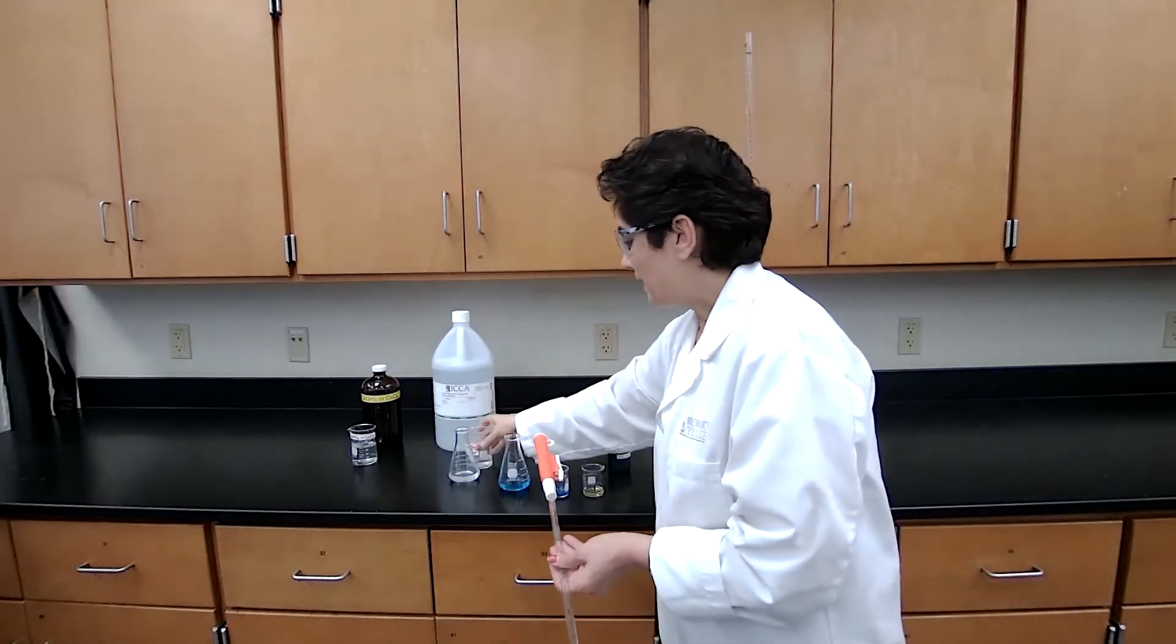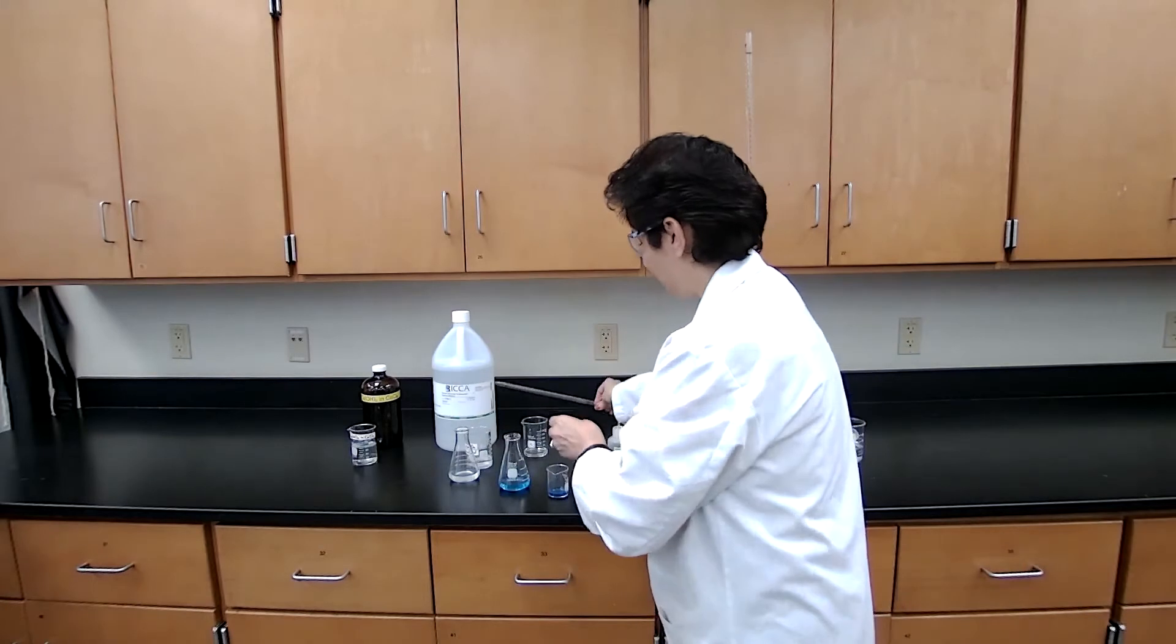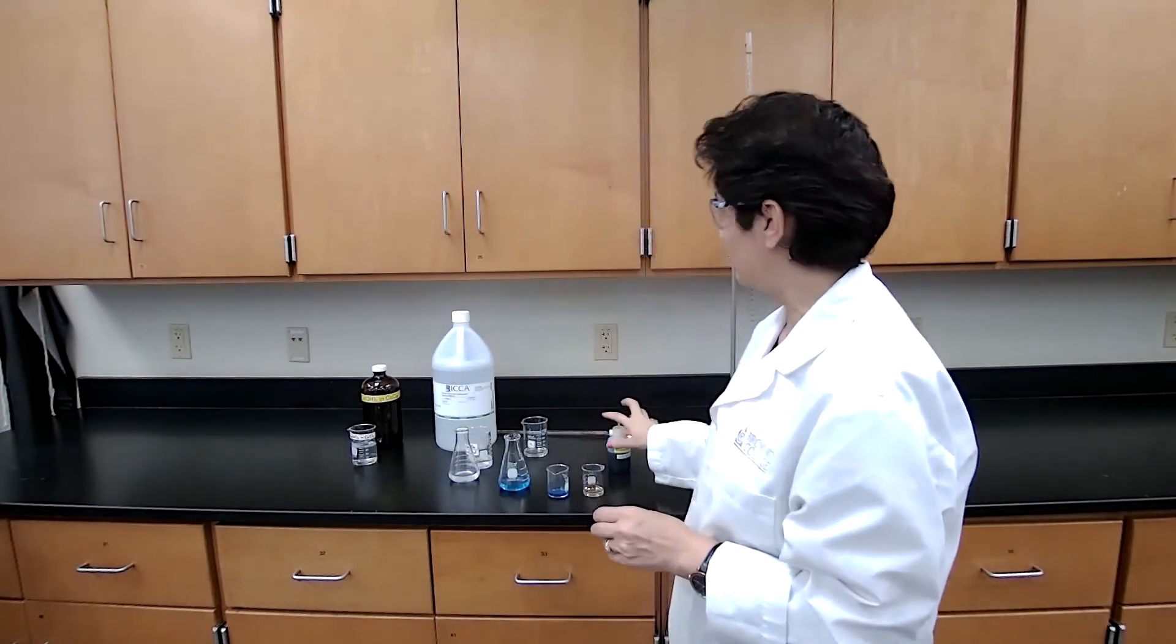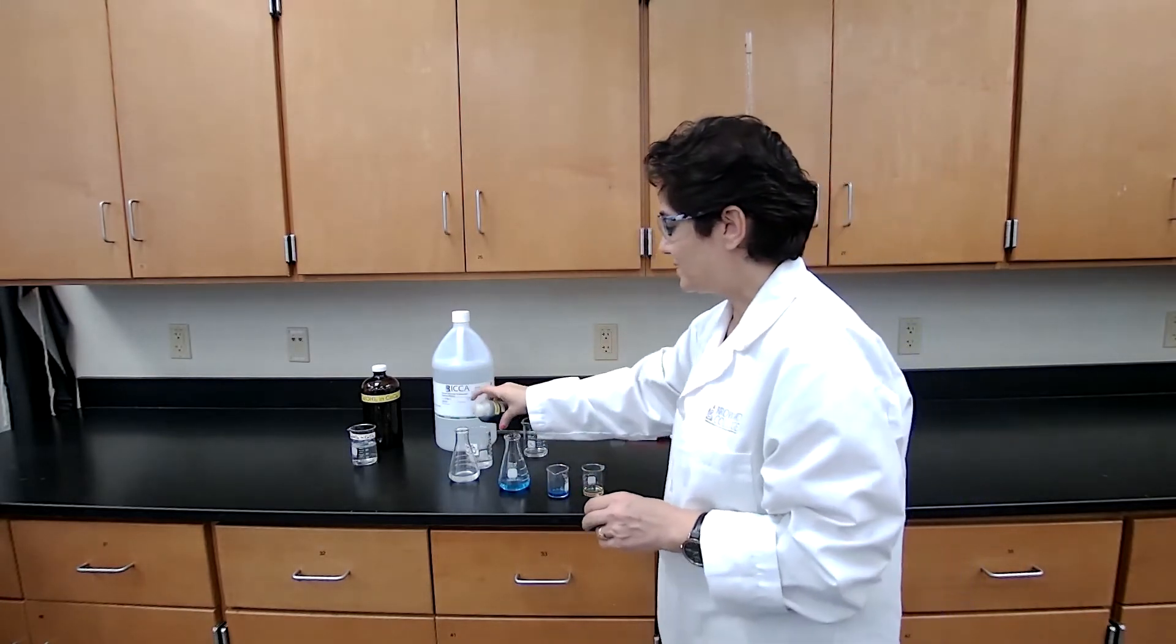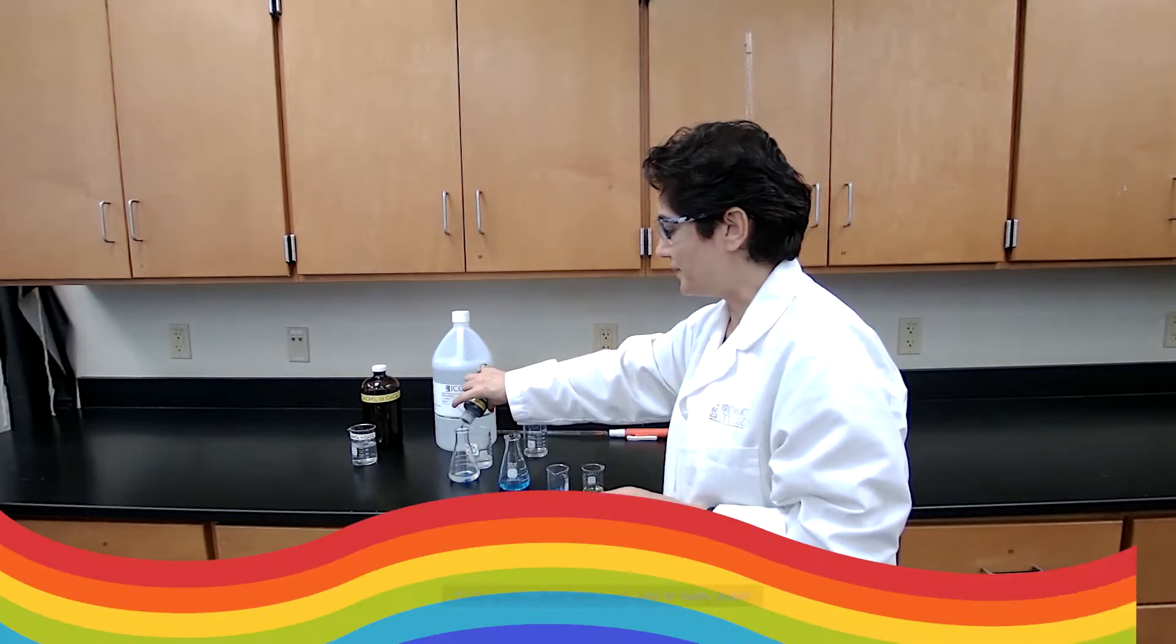So I have the base and I have the acid, the standard inside the burette. Let's go ahead and start the titration.